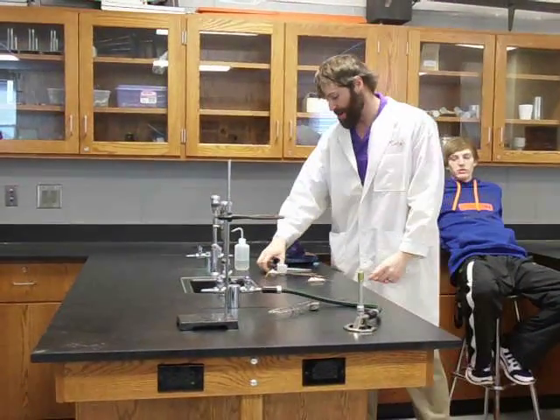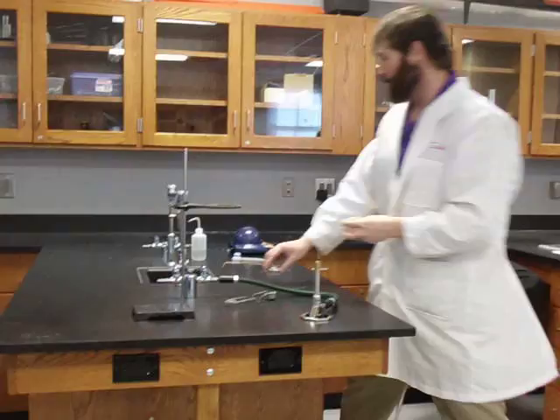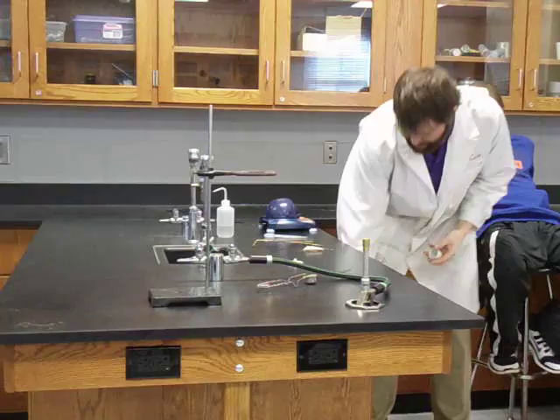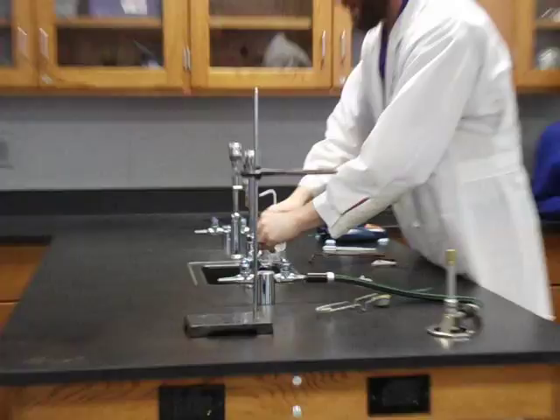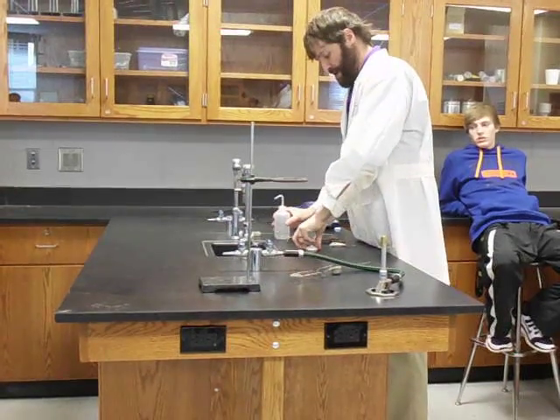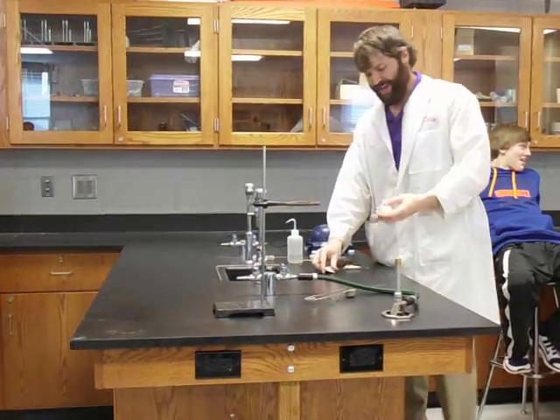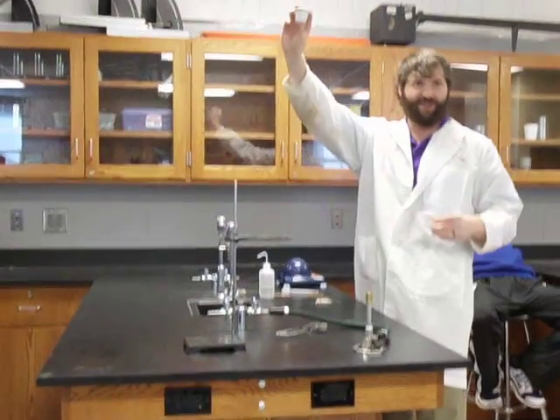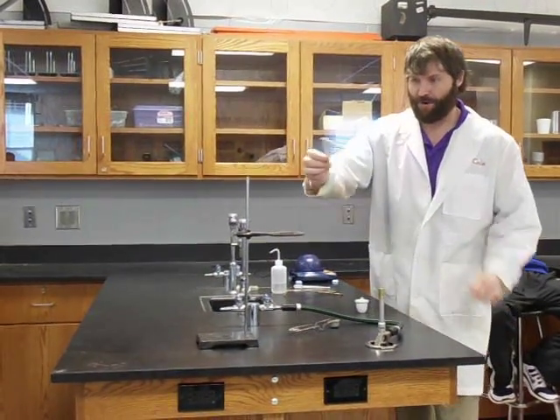Step number one: are you ready? The first thing I want you to do in this lab is clean and wash the crucible. Use a brush and some good soap. I don't really have any soap handy, but mine's already clean anyway. Wash this crucible and rinse it out really well with some distilled water, then clean and dry it.